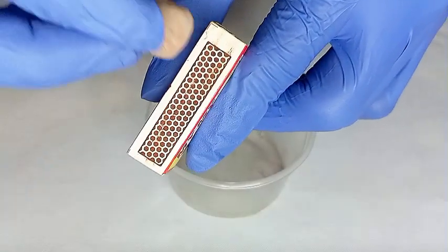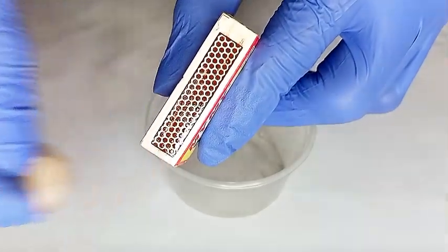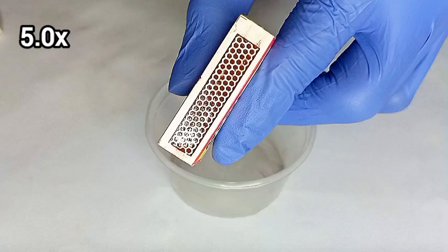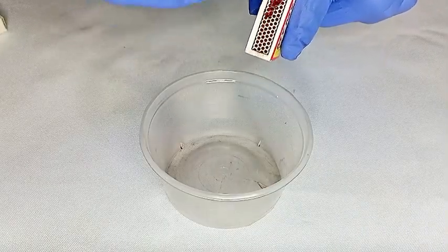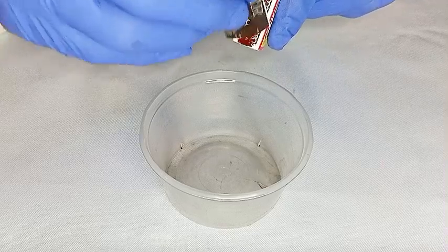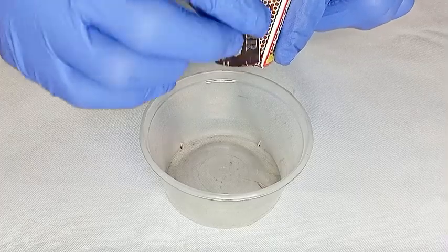To get the phosphorus, we dab the striker pad of the box with some water and leave it for about 10 seconds. Then we scrape off the phosphorus with a blade. We don't want it to soak for too long as it will make the box soggy, and if it doesn't soak long enough, you will be scraping off cardboard.